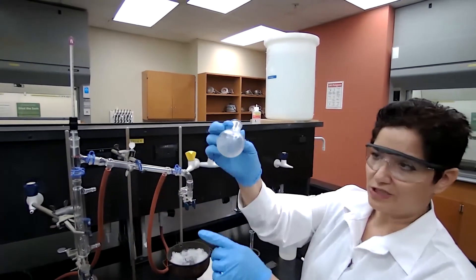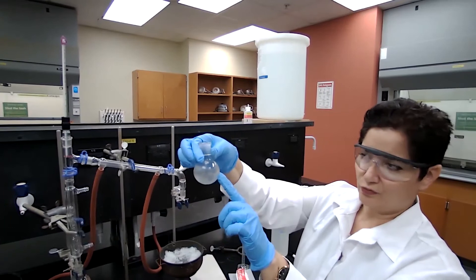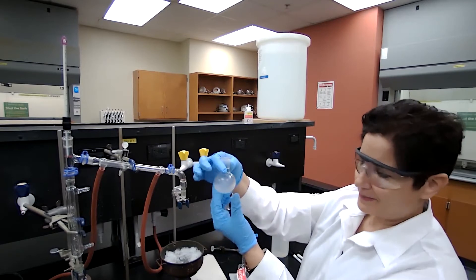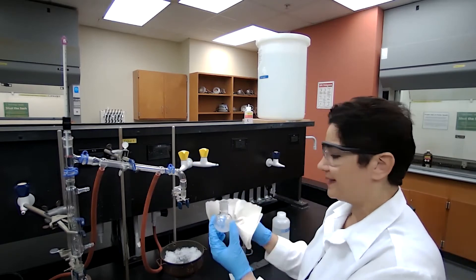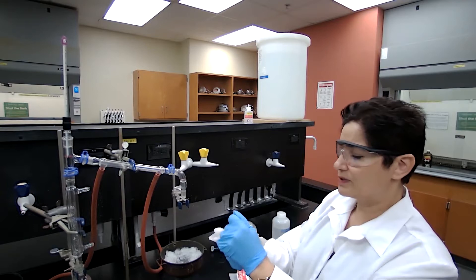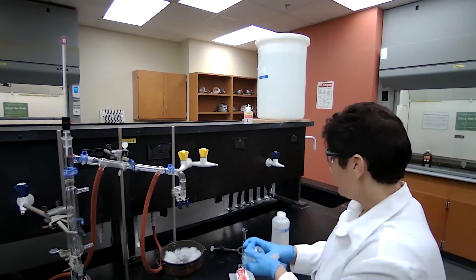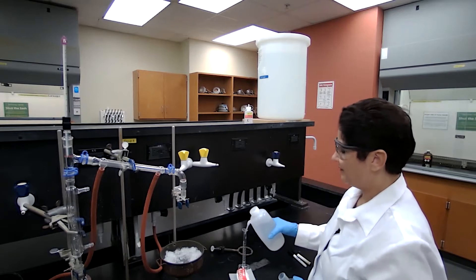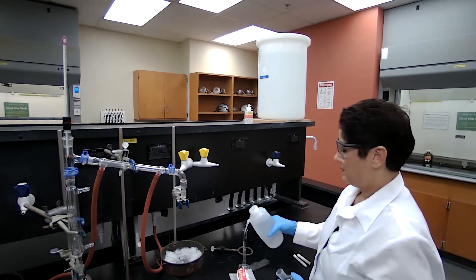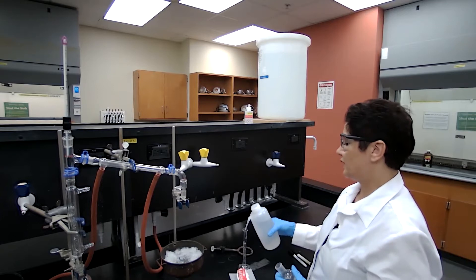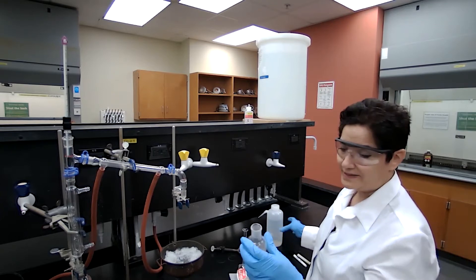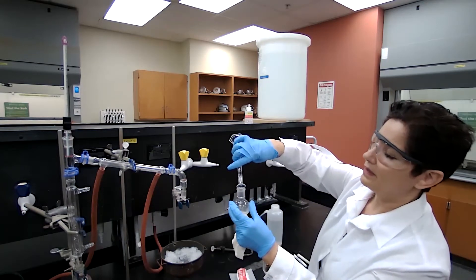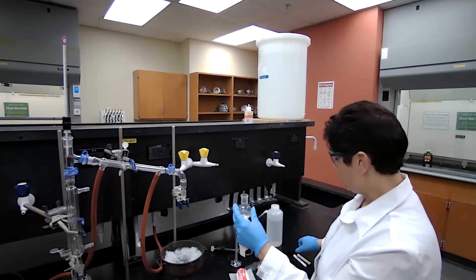There is no graduation line on this, so to find out when to stop, to make your job easier, here's my suggestion. I want to make sure the outside is dry so I can mark it. Then I'm going to get 10 milliliters of water because we are going to collect between nine and ten milliliters.